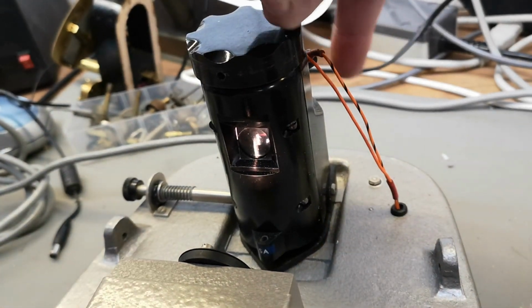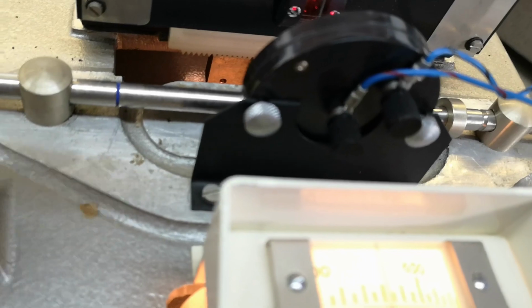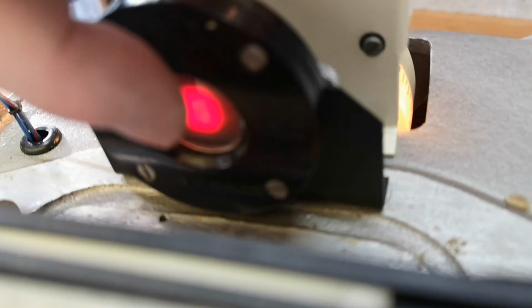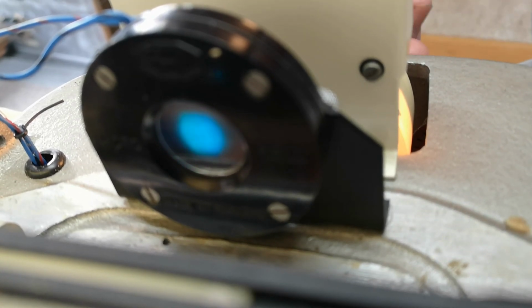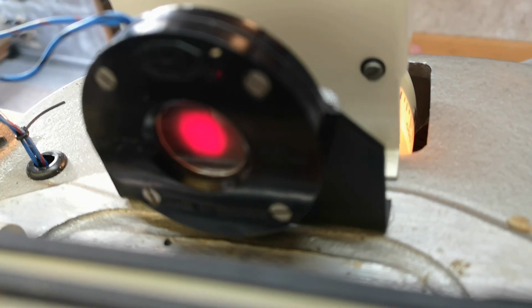So that will be the meter wires. It goes down to the base, or it's probably just connected directly to the sensor. So this is just probably a wideband detector or something. Oh, look what that is. That is a photo... Yeah. This is a sensor that just directly converts light to voltage. Here you can see the different colors. Wow. I really, really love this. How can they make all those different colors just by a filter?